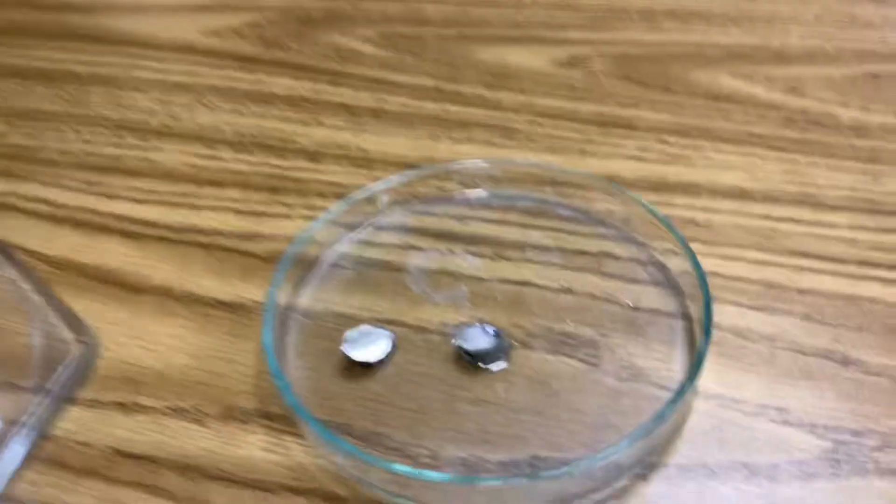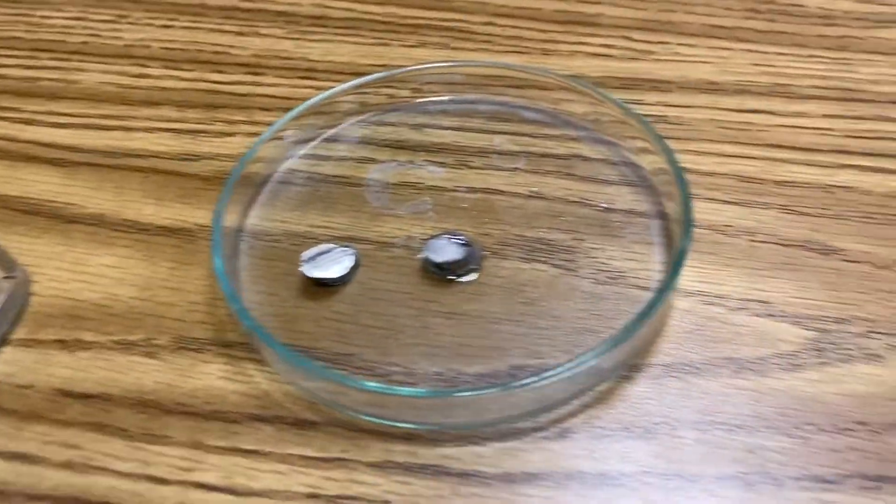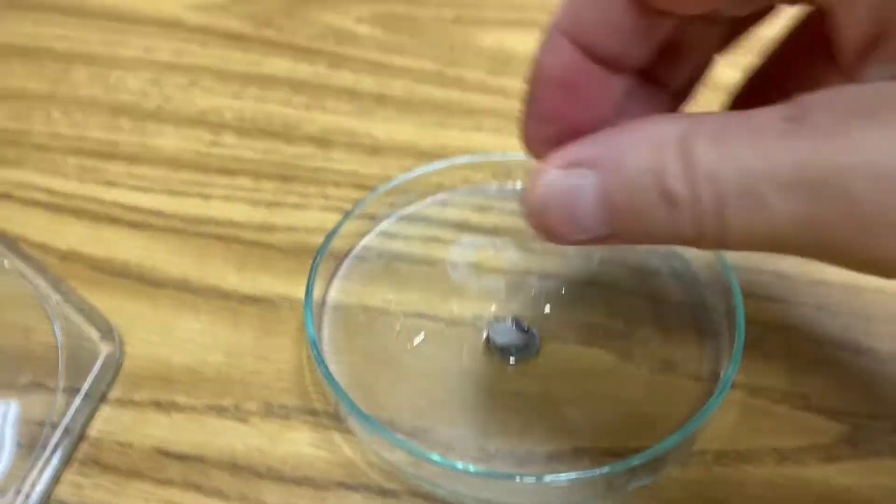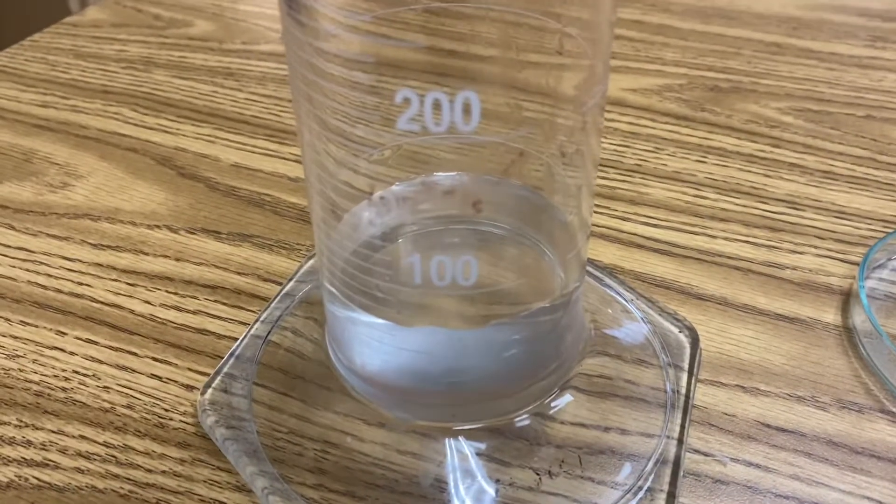Now we're gonna add just a very small piece of lithium to our water and this is a single displacement reaction. The lithium will change into hydrogen gas, lithium hydroxide, and this will happen very quickly.